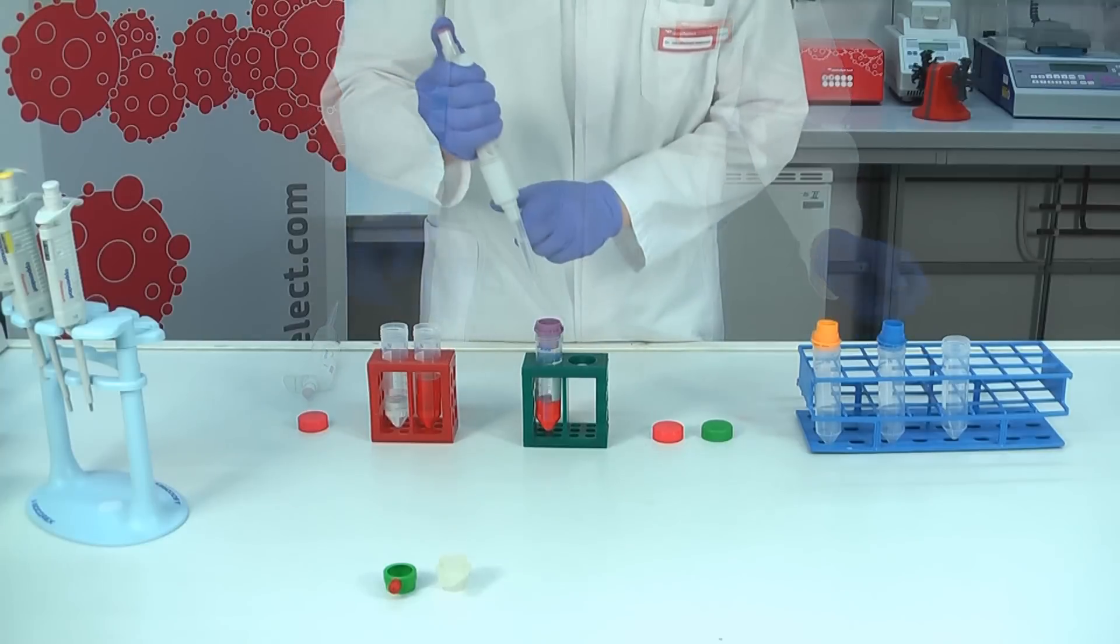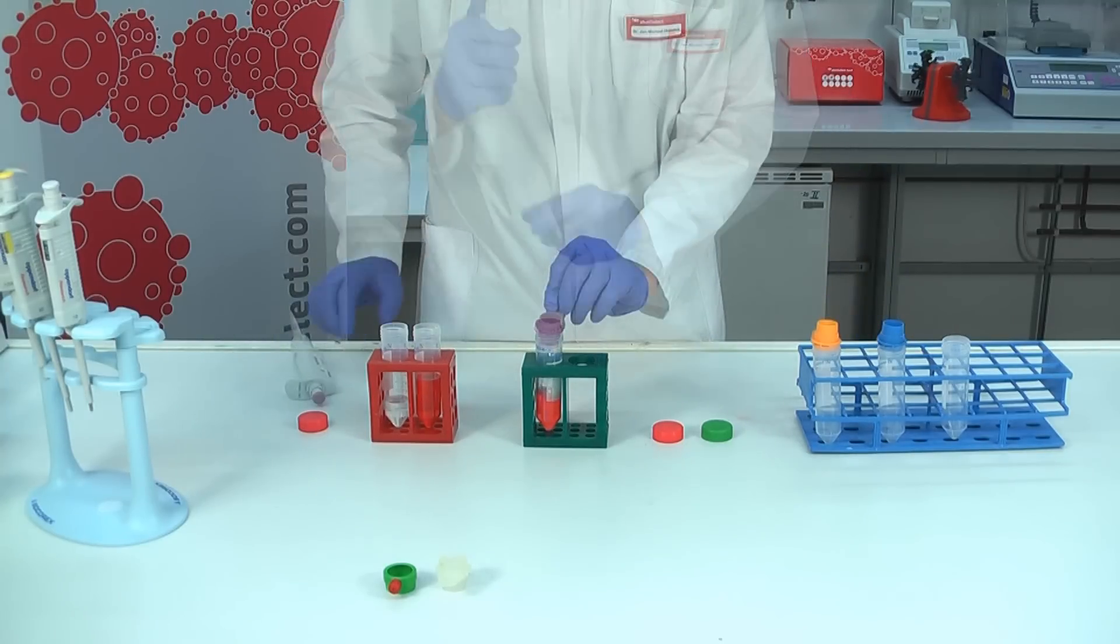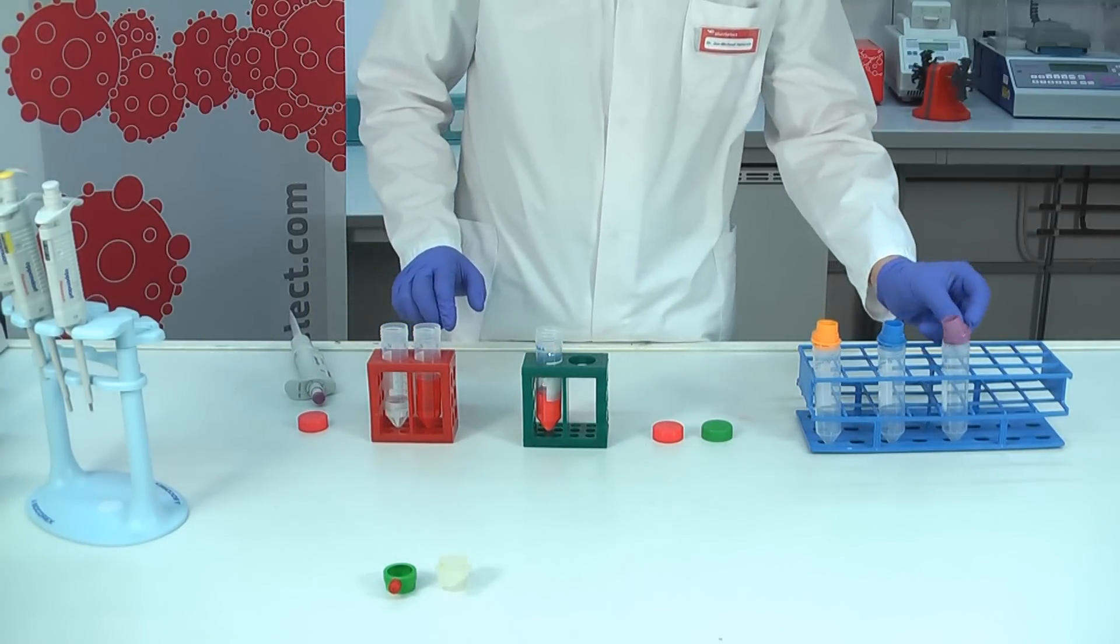An angle on the strainer will support the flow of the cells into your tube. This is a special feature of pluriStrainers.